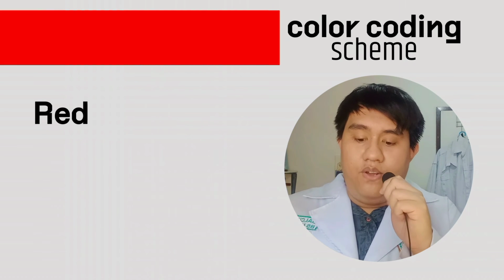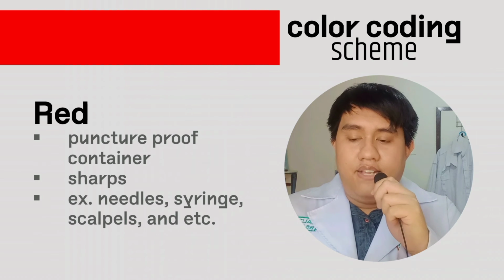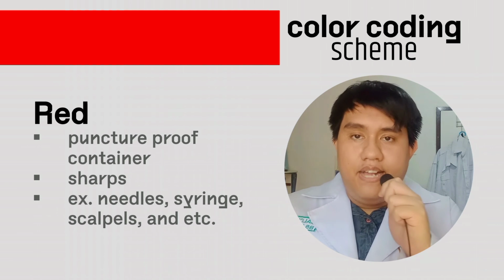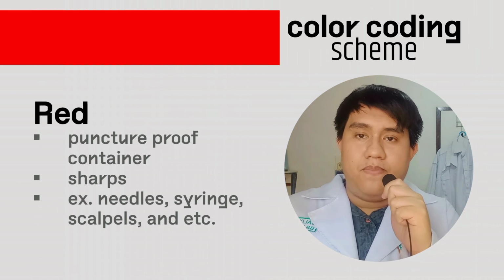Next, we have the red or the sharps collector. This has a puncture-proof type of container, and it has sharps as a type of waste. Examples for this, we have the needles, syringes, scalpels, and etc.